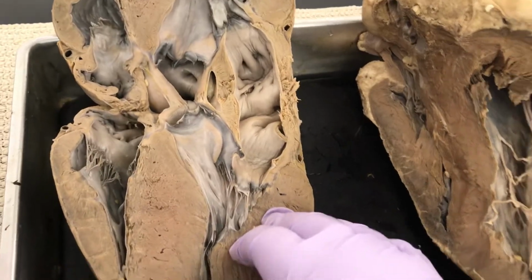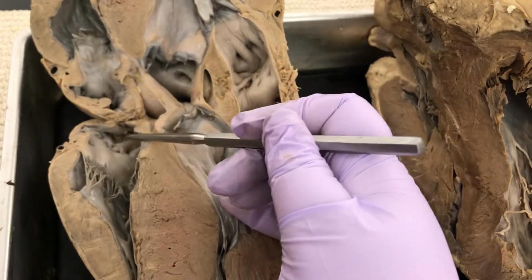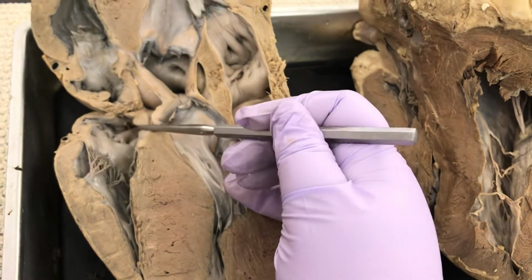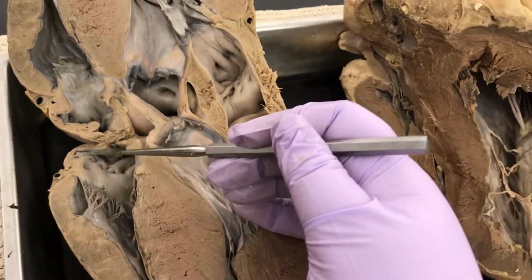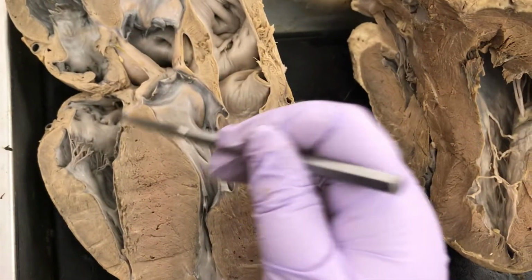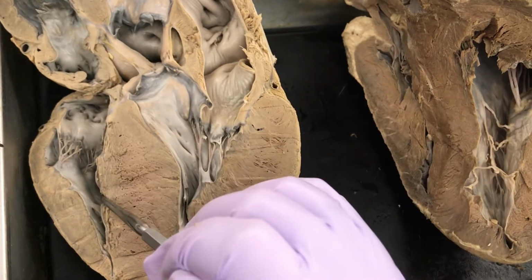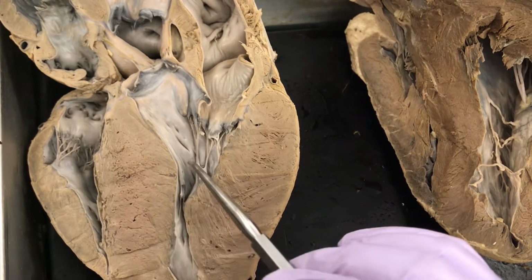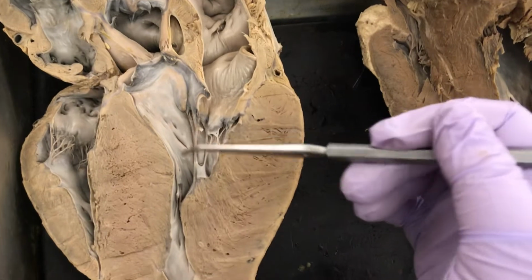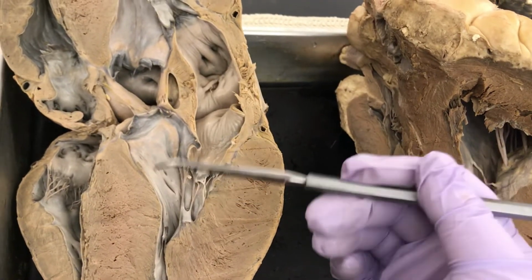Inside we have four open spaces. It's kind of tough to see that on these hearts, but just be aware, anything above the bicuspid or tricuspid valves, everything above those valves is the atriums. So this would be the right atrium, left atrium. Below the valve is the ventricle. So this is the right ventricle, and this is the left ventricle. On the exam, I would probably ask, what is this open space? What is this chamber? Might be what they ask.